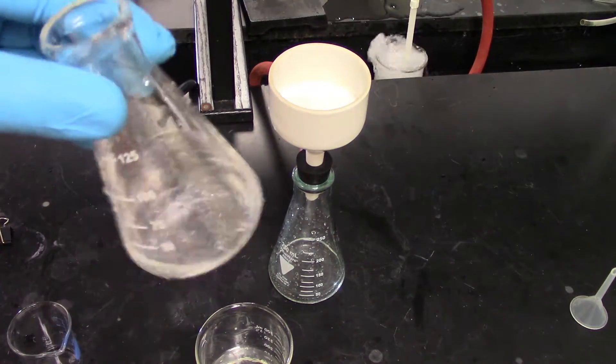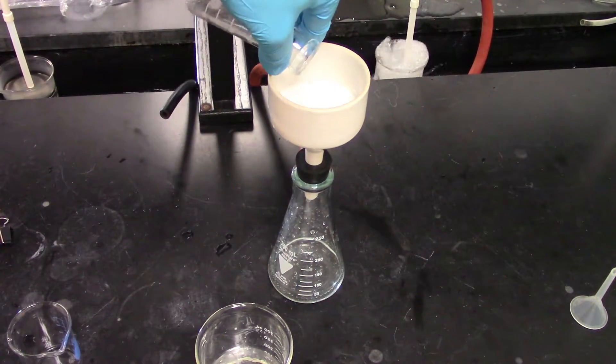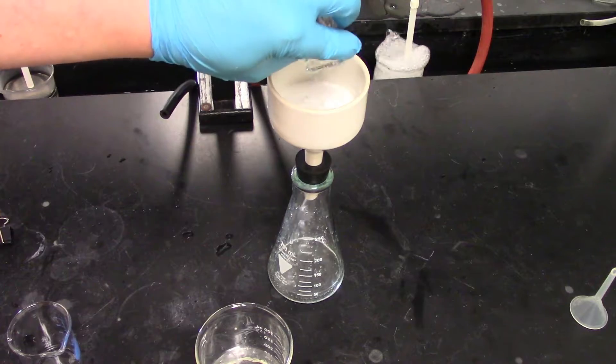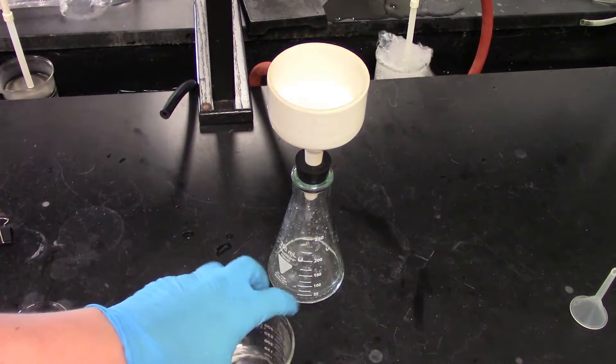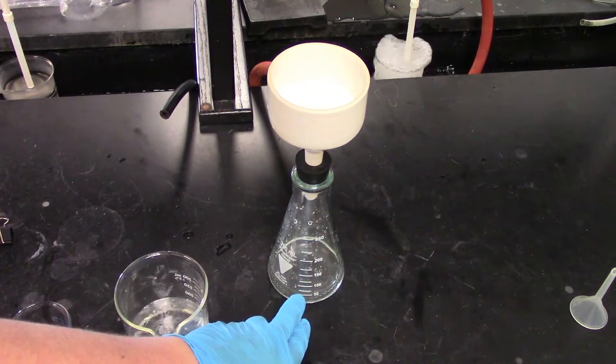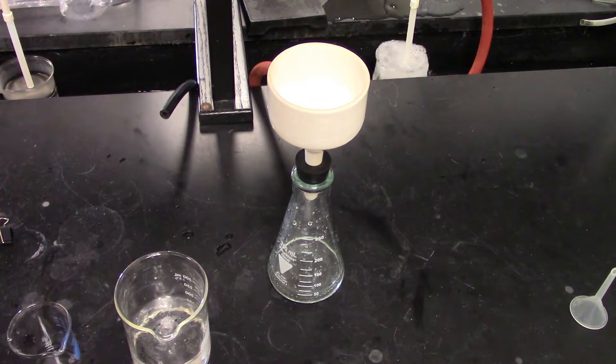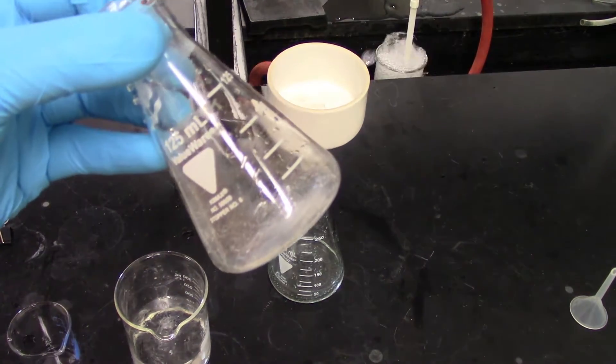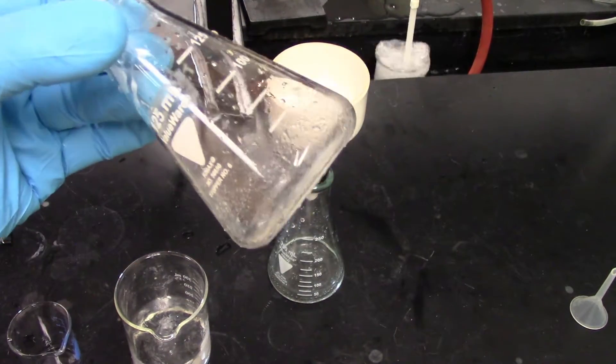I'm going to get the sucker good and washed out. You can see I've got good filtration, I don't see any crystals really coming through to the bottom. I am going to have some stuff stuck to the flask, this is just going to be an inherent loss.